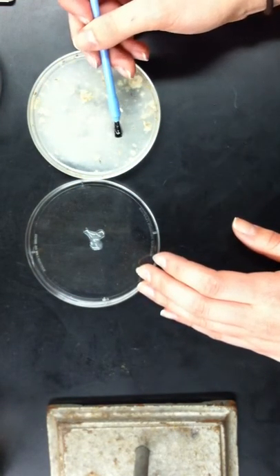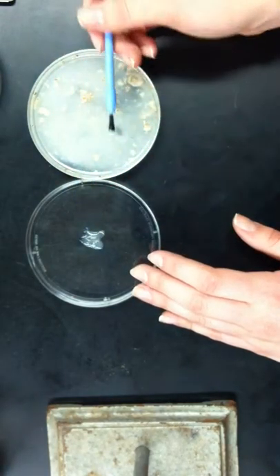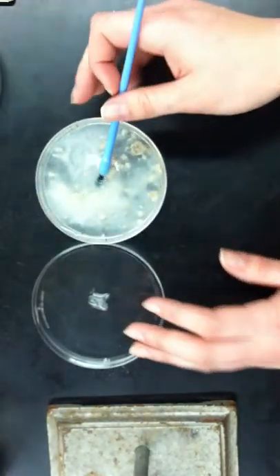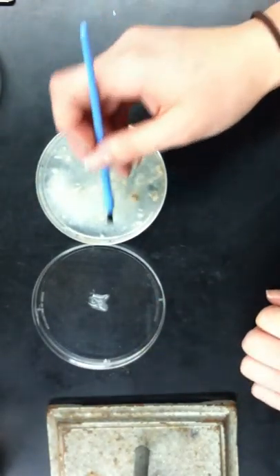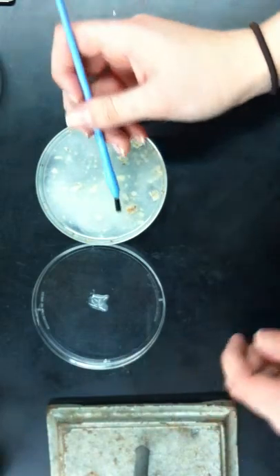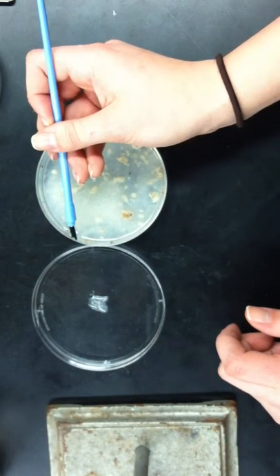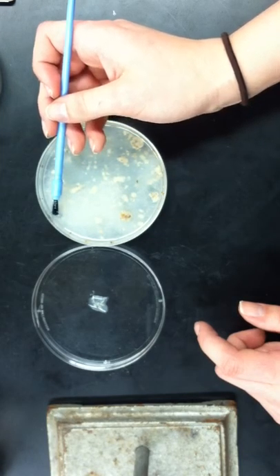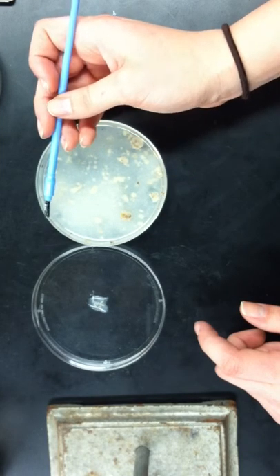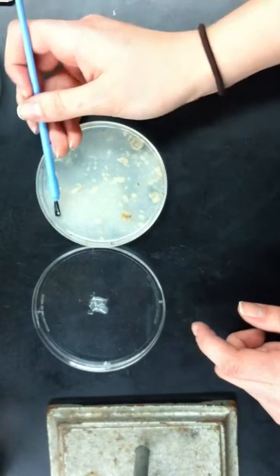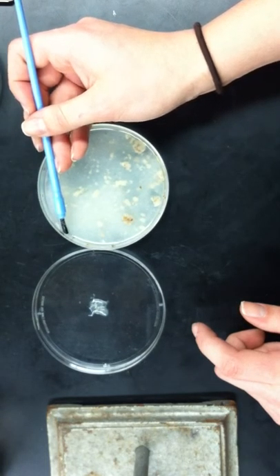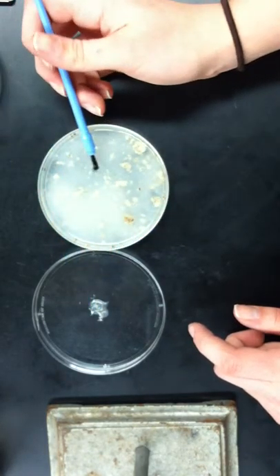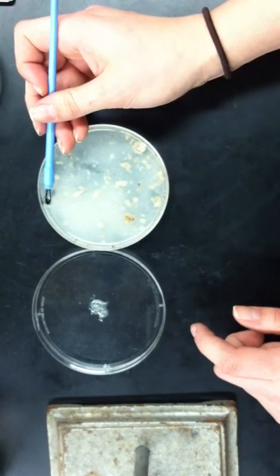Usually, per testing or trial, you want to get approximately 15 to 30 larvae from here. And if you begin to see that there aren't many larvae left, you can't find them easily enough, you can just take another scoop from the fecund vial. They like to gather on the side, so it makes it easier to pick them up there. I've got a few here.